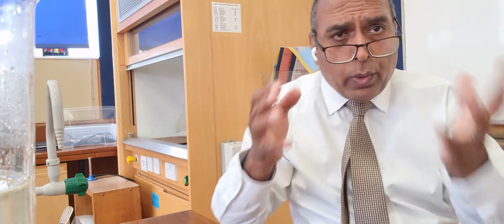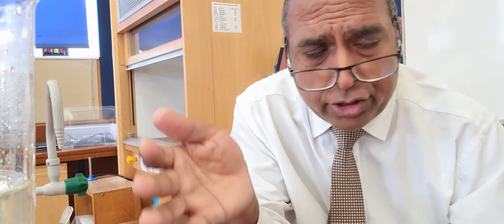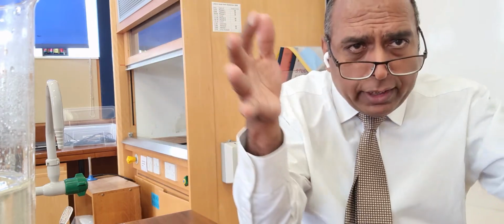Now when a solution dissolves and it's hot and there's quite a lot dissolved, then when you cool it down, the solubility of the solid is less, and as you cool it down, the extra solid that was dissolved, that can no longer stay dissolved, comes out as crystals. The process of cooling down a solution and getting crystals is known as, believe it or not, crystallization.